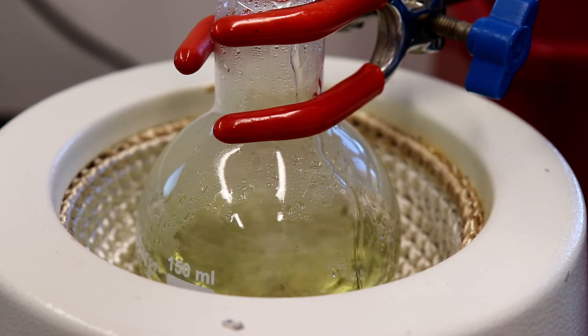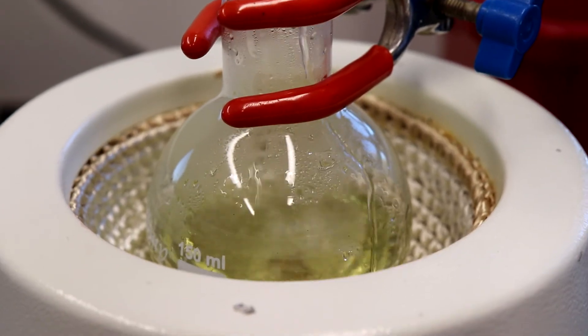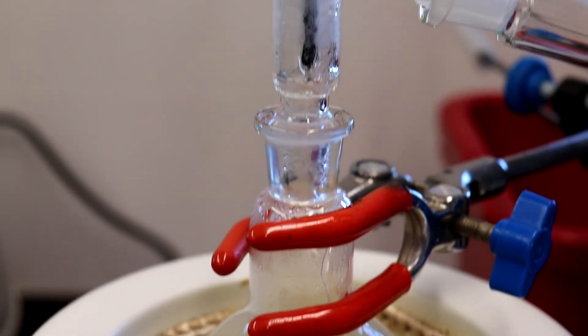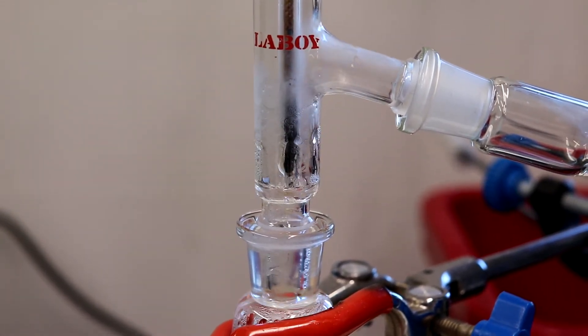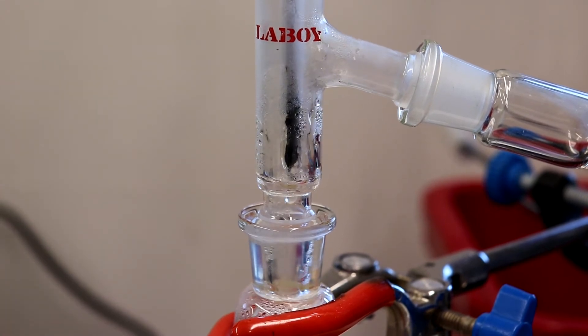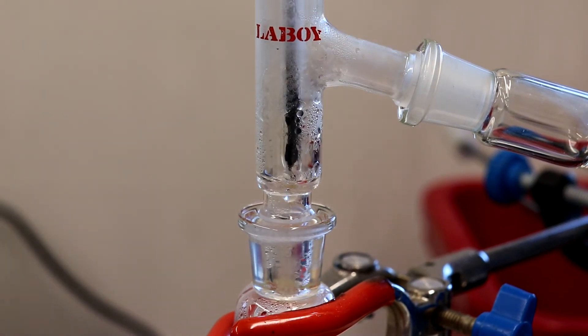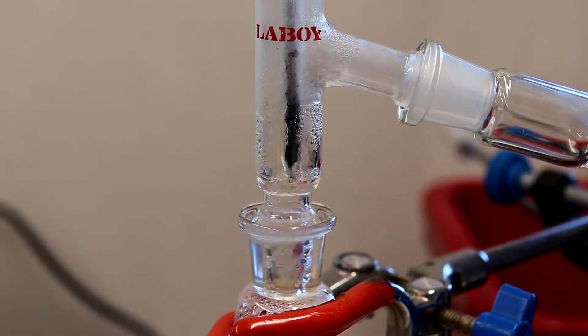So the product is slowly making its way up the distillation head towards the condenser. The temperature is climbing. It's rapidly increasing right now at 150. Still going up.